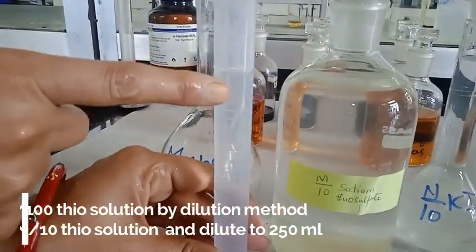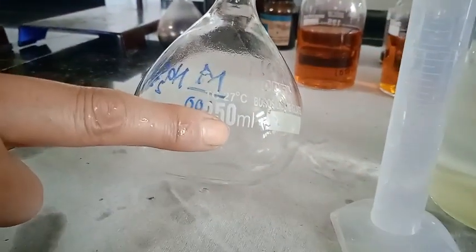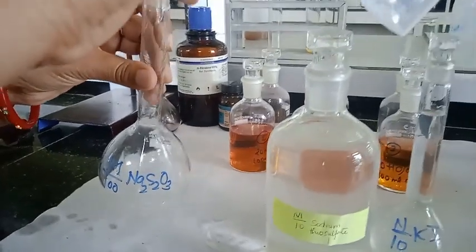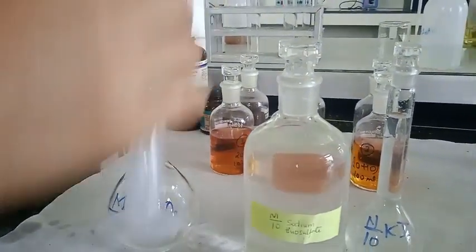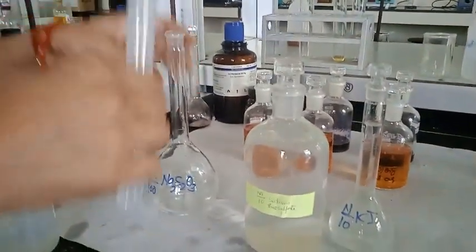So from this M by 10, we are going to prepare M by 100 in 250 ml. For that purpose, I have to take 25 ml of M by 10 solution, and I am going to transfer it into the measuring flask of 250 ml and make up the solution up to the mark of 250 ml.